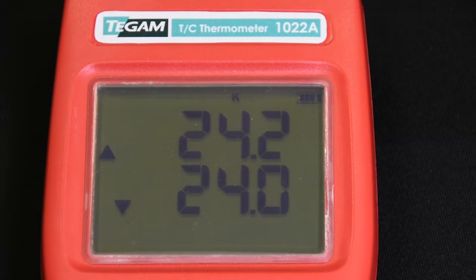You'll see that the temperature units are flashing on the LCD. This indicates that the temperature units are the active parameter.